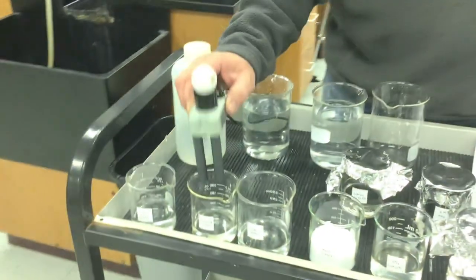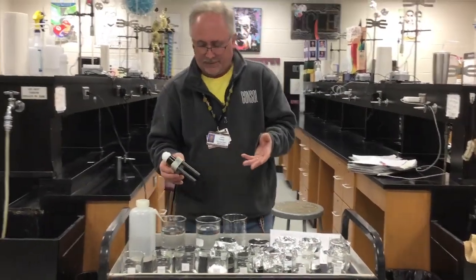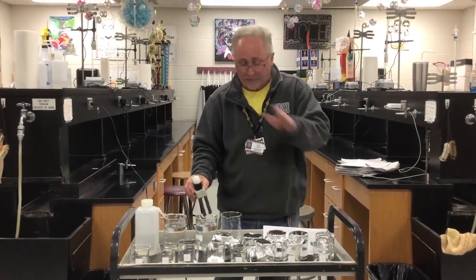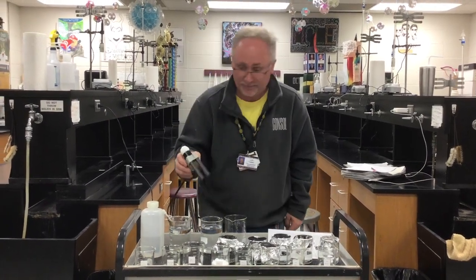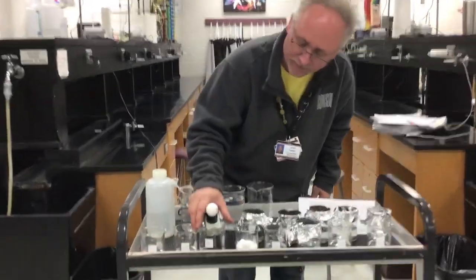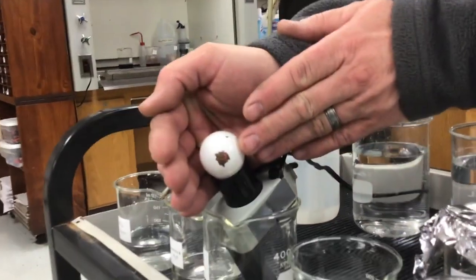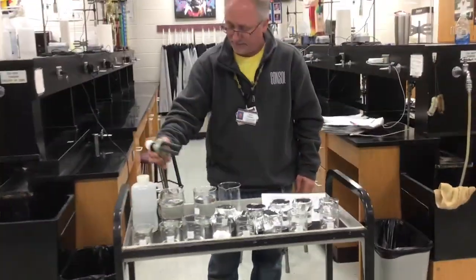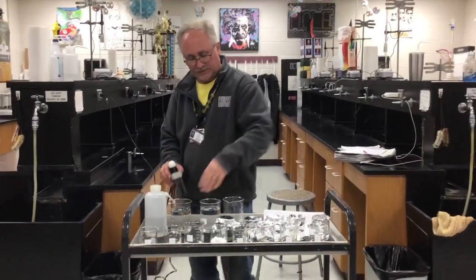So, distilled water has a little bit of ions in solution. You would know not to be exposed to electricity and stand in a pool of distilled water. I'm sorry, distilled water would be fine, my bad. It's tap water that would be different. We're going to have to do this again because the next one's tap water. Wow, this is one of my best videos ever. Okay, can you see it in there? You might see that the tap water is lighting up just a tiny bit. The distilled water should not have conducted electricity. That's my bad, guys. So that would be the salt solution, the distilled water, and then the tap water.